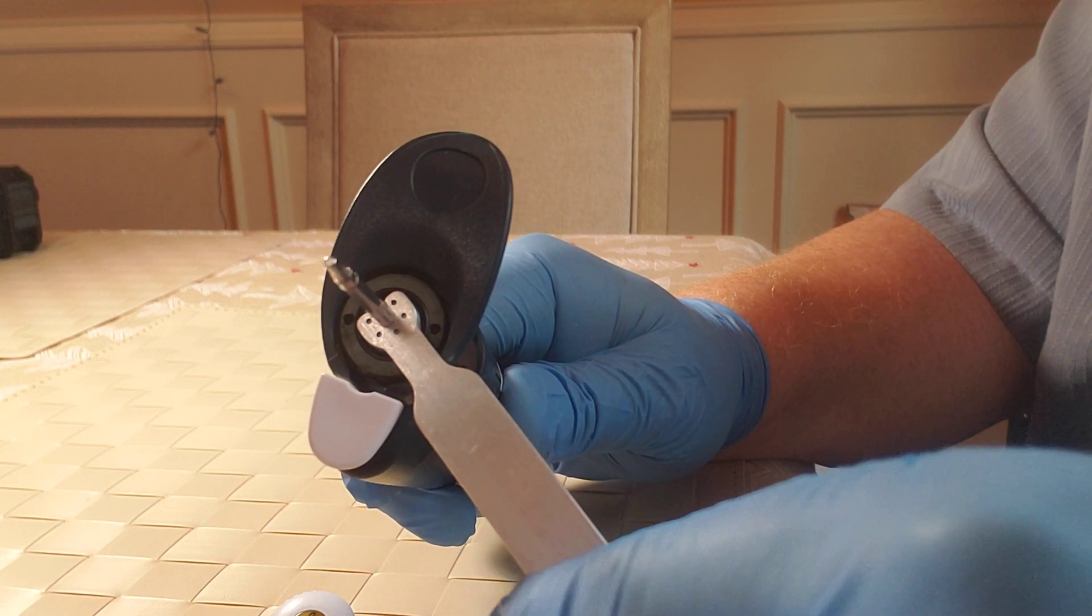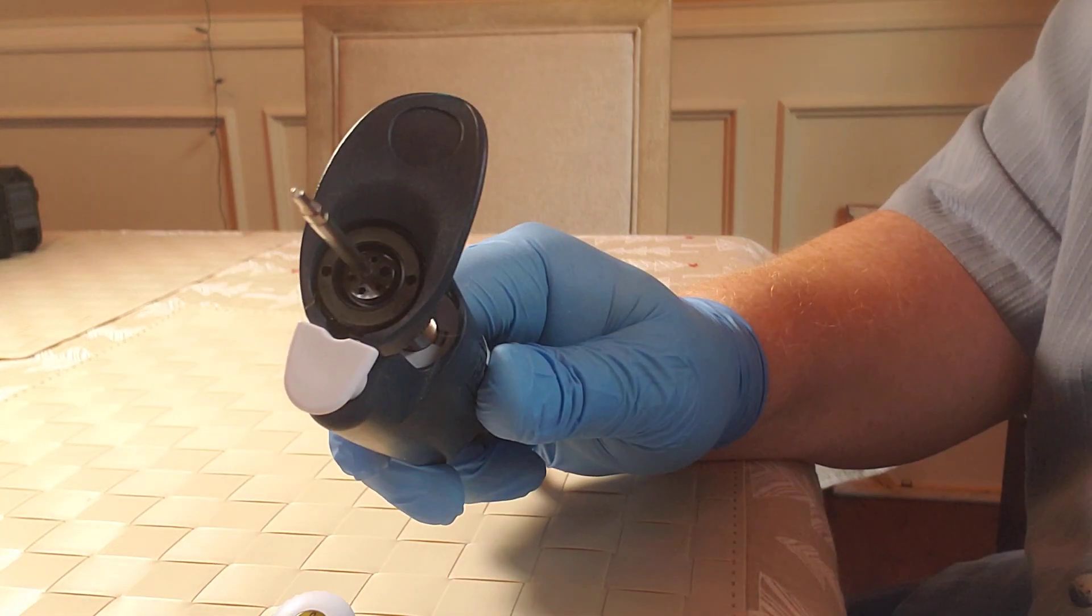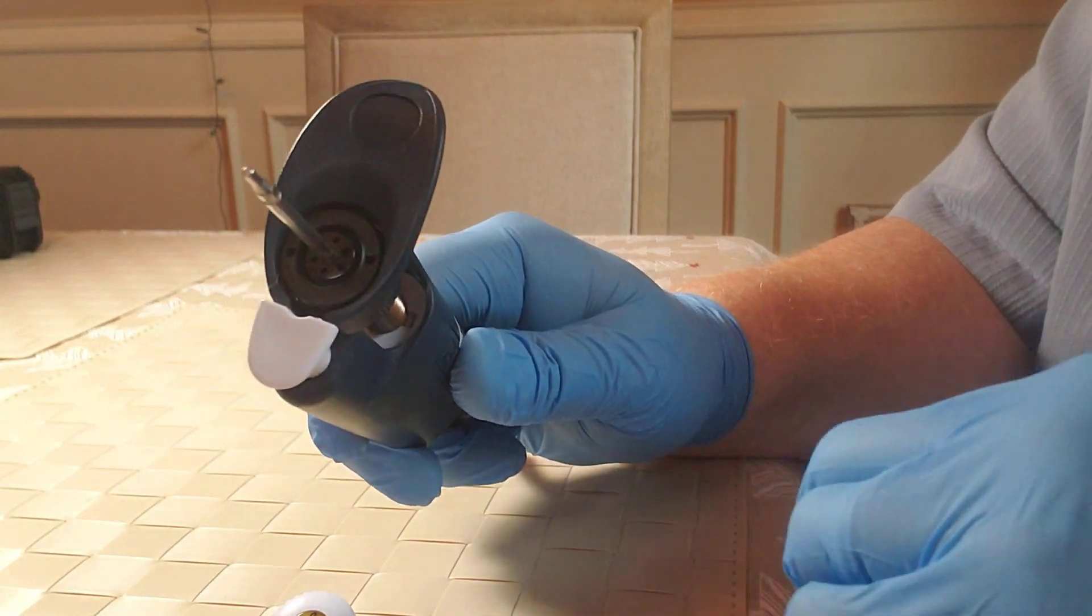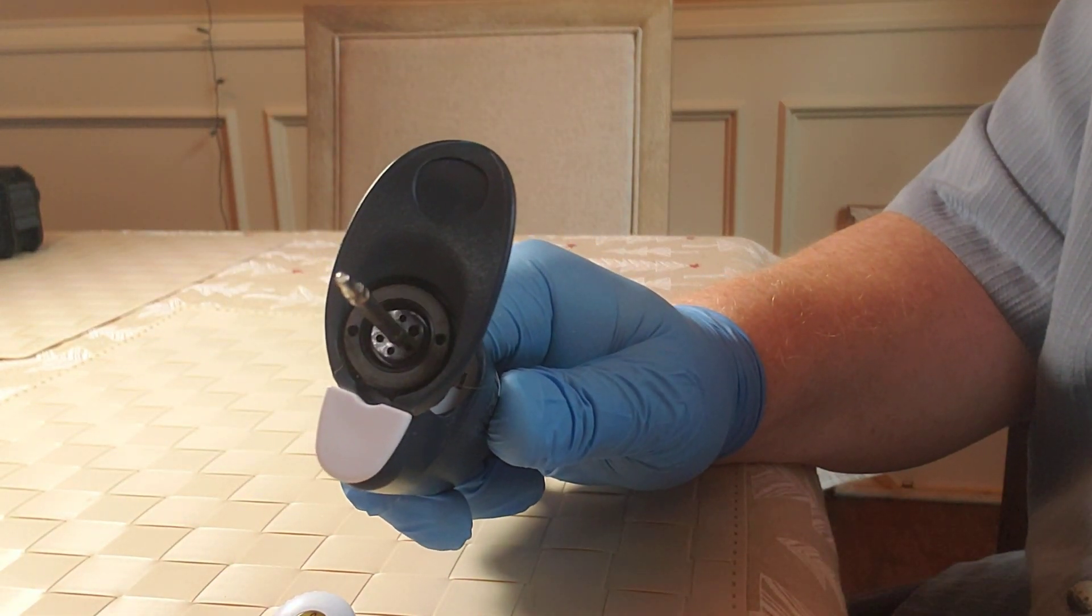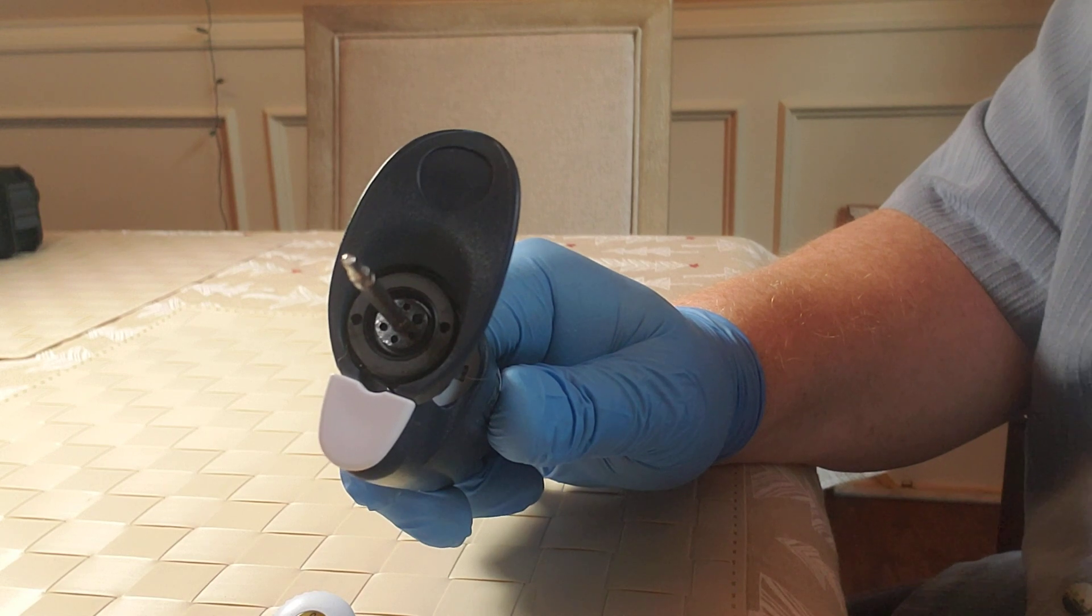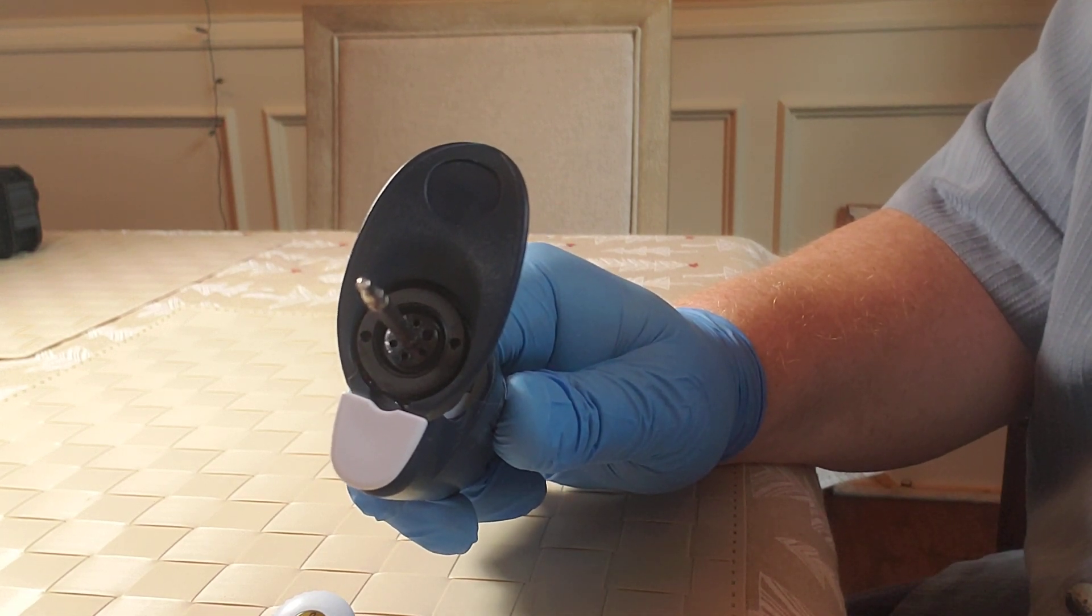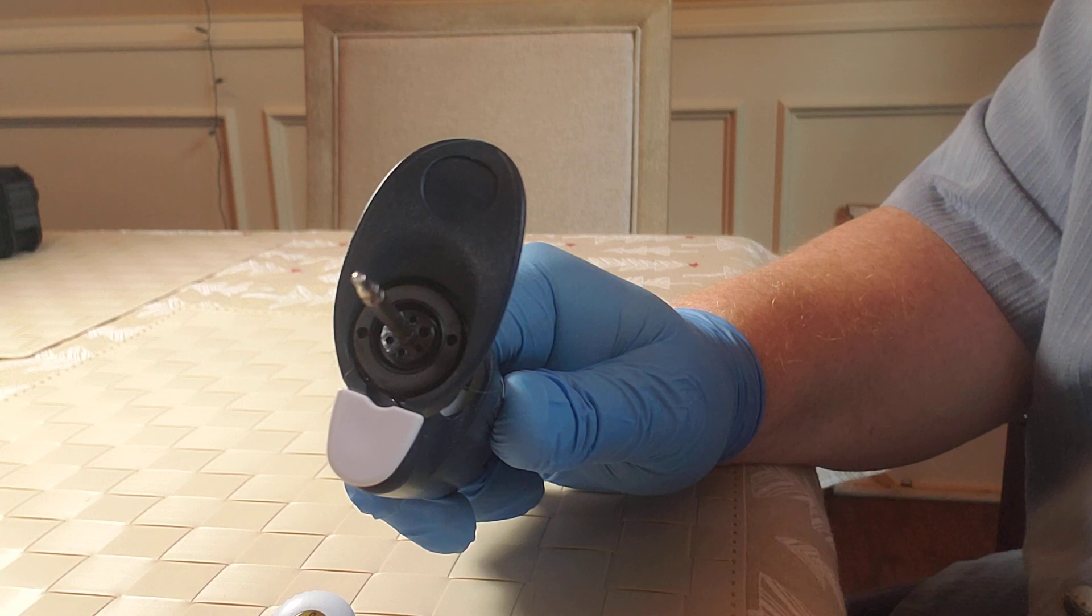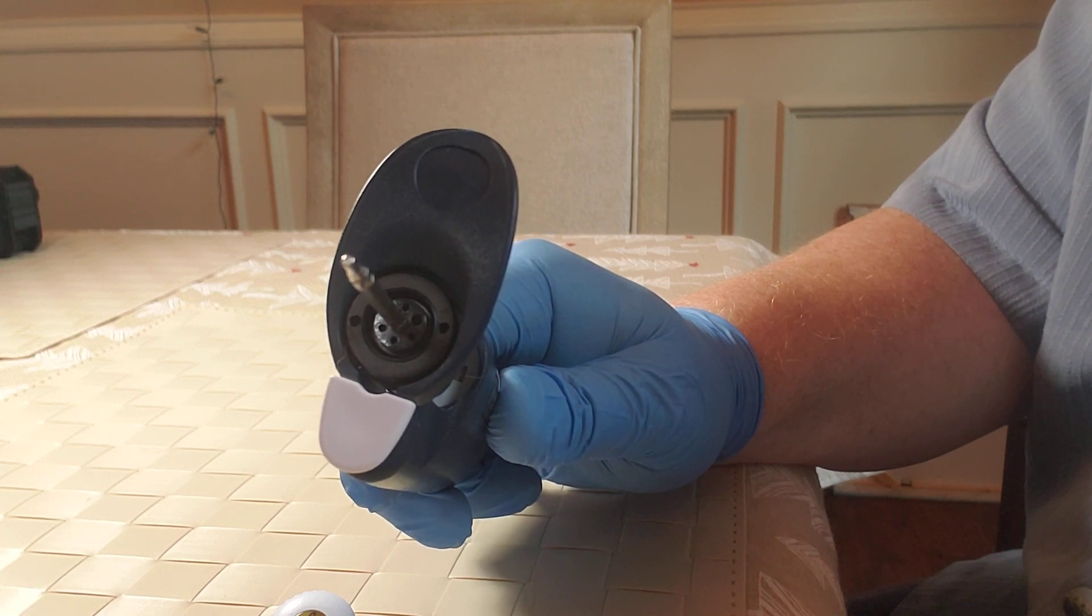Once you've made an adjustment, then go to the balance, remove the tool, and then verify that the volume is achieved that you want. If not, repeat this process until the desired volume that is aspirated and dispensed meets your expectations.